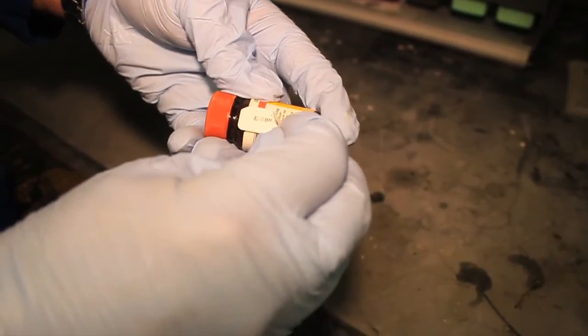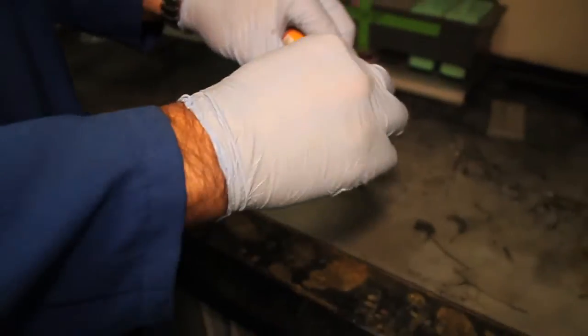To dispose of small dry chemical bottles of this size or smaller, simply peel off the label. Place it on the barcode sheet provided.